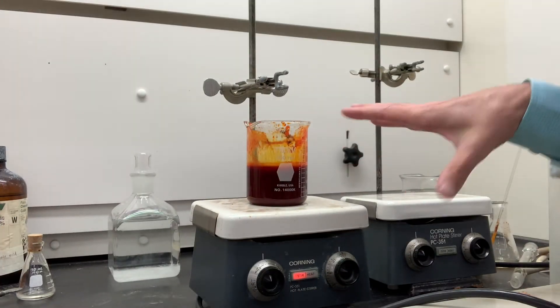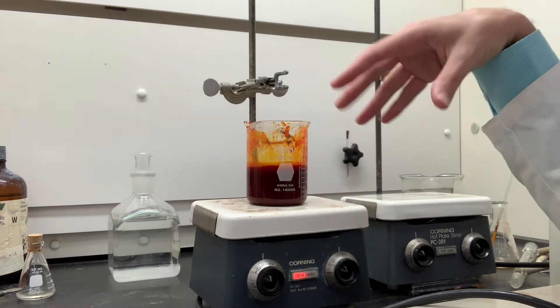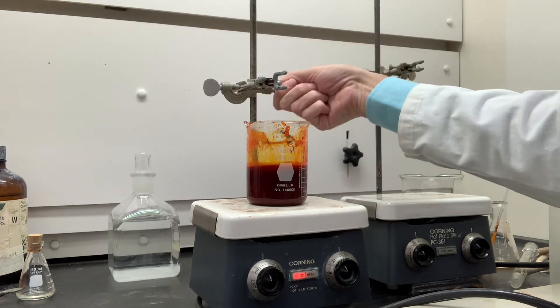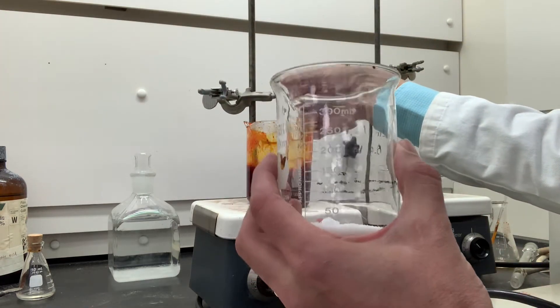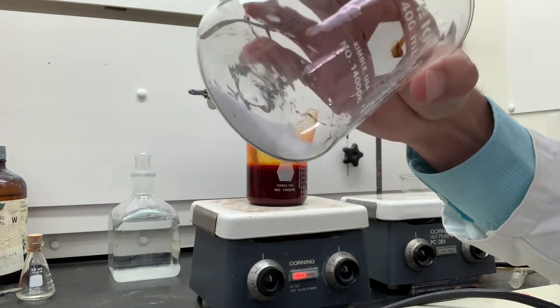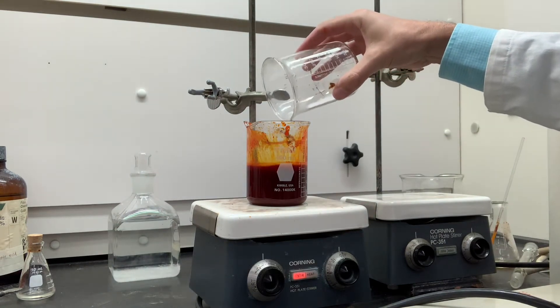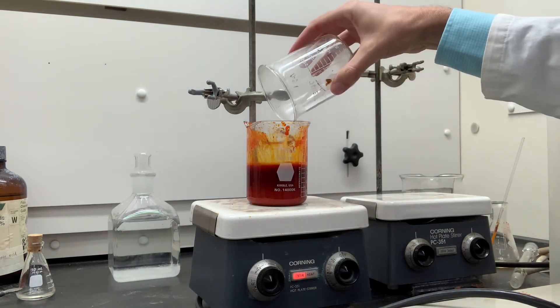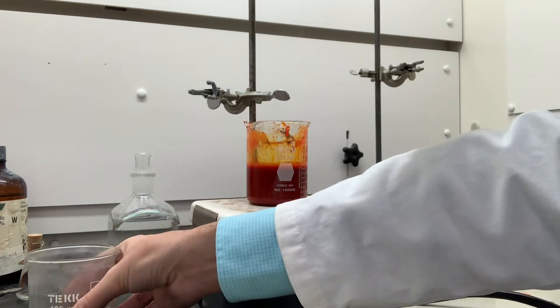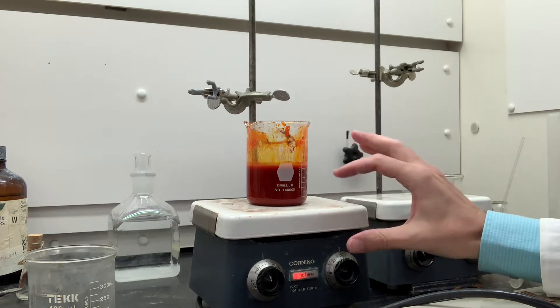So we've been heating this for about 20 minutes now, and it's all as much dissolved as we can. Now what I'm going to do is add solid, which is a very strange procedure — add 10 grams of sodium chloride. It's quite a bit in there. We'll just dump that in there like so. There's precipitation a little bit, and I turned the heater off.